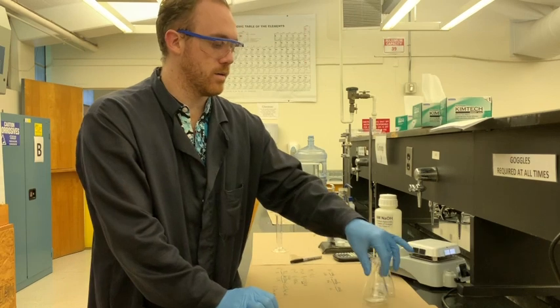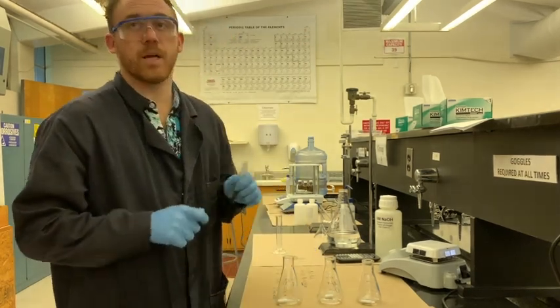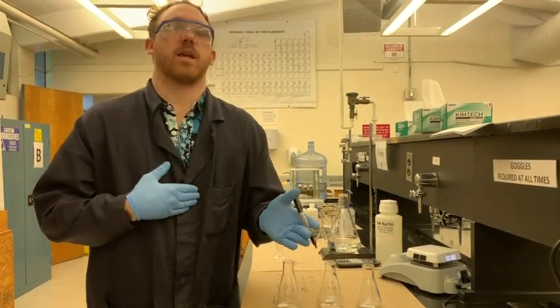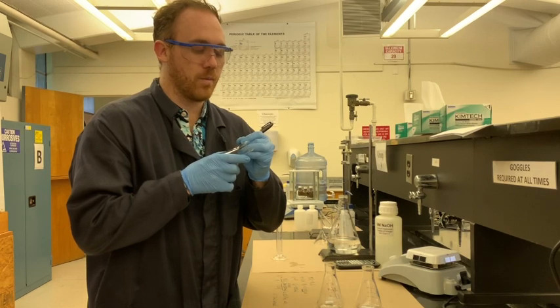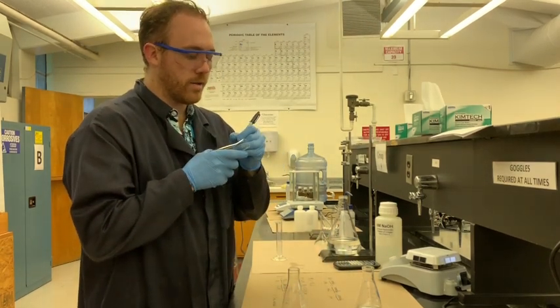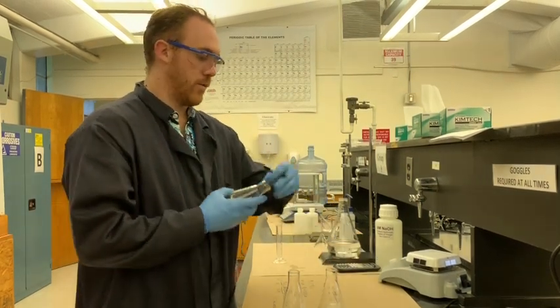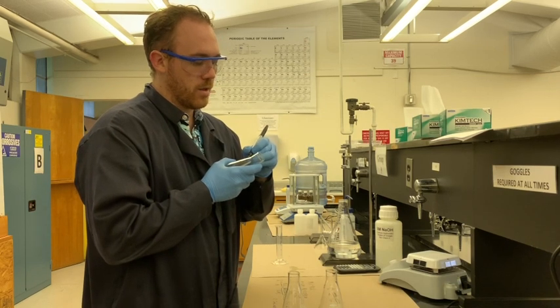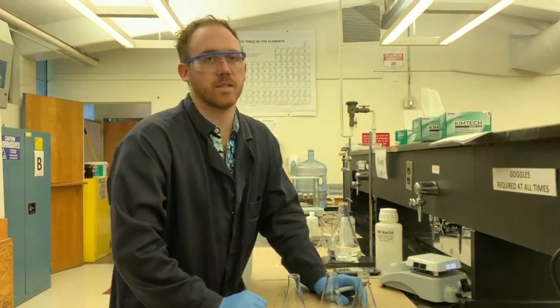So we're going to have 3 samples here, and these 3 samples are going to each have their own number, because the amount of KHP inside of them will be figured into the calculations as the number of moles of KHP, and based on the number of milliliters of the NaOH that were placed into each of these individual samples, you'll have an individual amount of the sample that we calculated to be in here. What ends up mattering is the way that all of these calculations, whether you add a little bit more NaOH or a little bit less, all work out to correspond to the right amount of KHP. Don't spend 30 minutes at the scale trying to make sure you have exactly 0.500 grams of KHP, because you're just going to make your lab mates completely crazy.